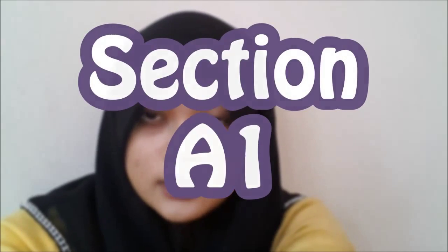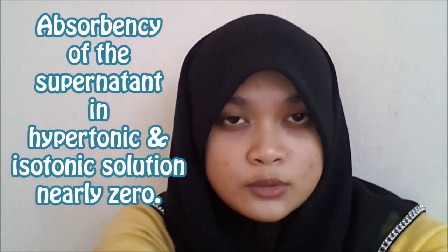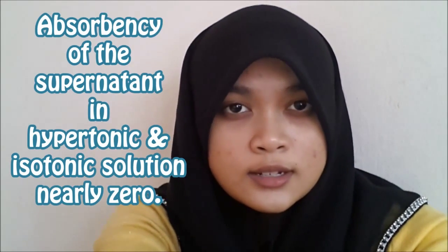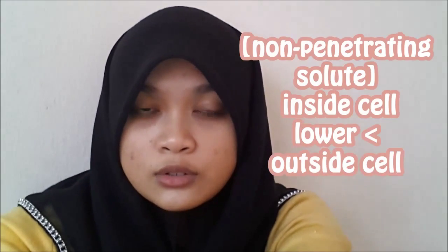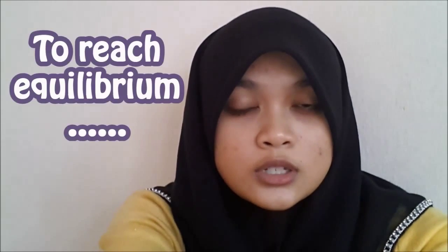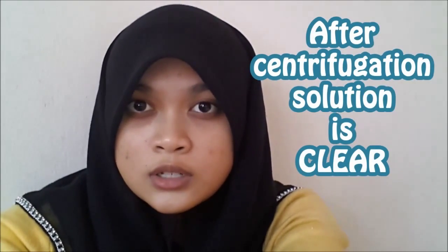In Section A1, the absorbance of the supernatant in hypertonic solution and isotonic solution are nearly zero. In hypertonic solution, the concentration of non-penetrating solutes inside the cell is lower compared to outside the cell. So to reach equilibrium, the water inside the cell moves out from the cell. This will cause the cell to shrink. The solution after the centrifugation is clear.